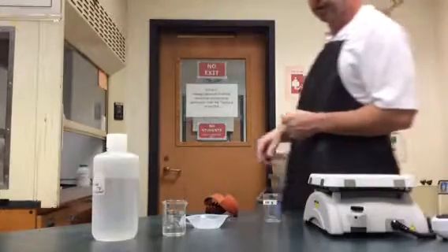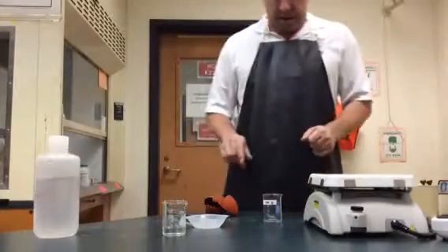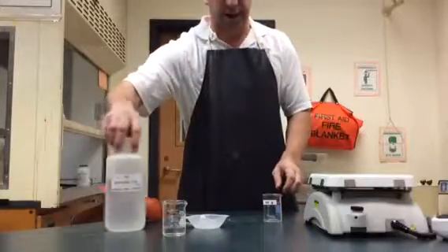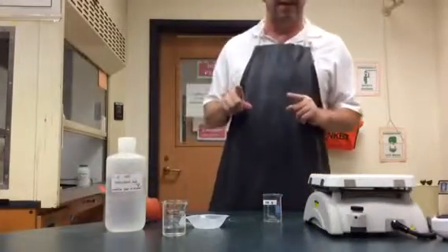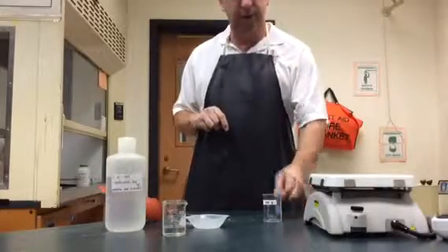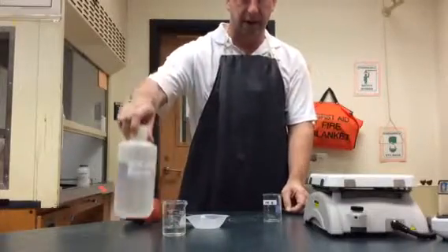In a similar chemical reaction as the one we have done before, we're going to react magnesium along with some hydrochloric acid. It's going to feel an awful lot like the 'let's make a salt' lab, except we're using magnesium — you can see it here — along with hydrochloric acid.